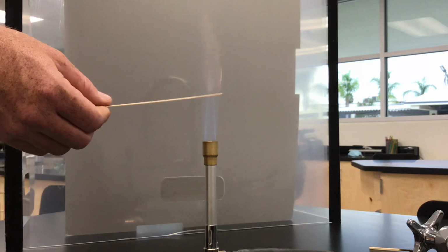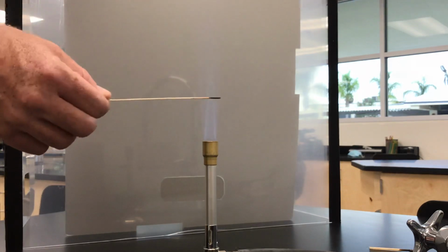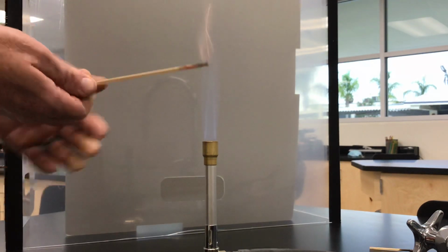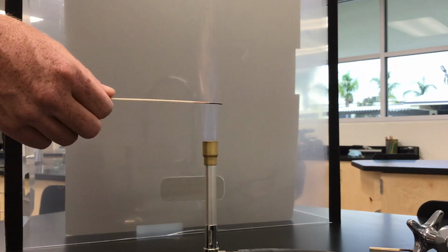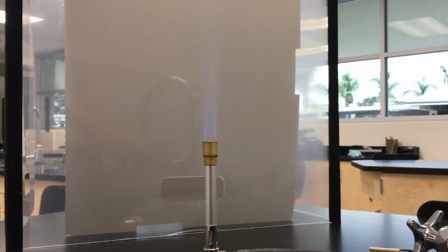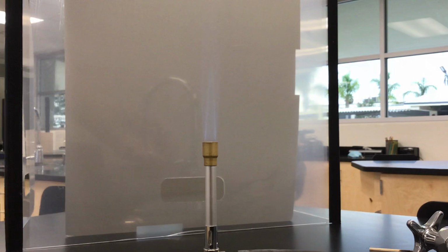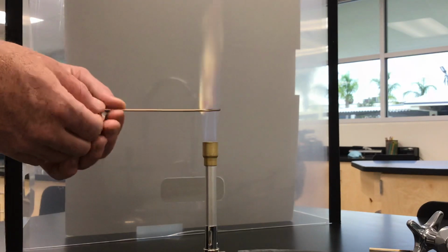Cobalt. So once again, you're telling me observations that you see. So based on what you see, you'll identify some unknowns in a couple minutes. That is cobalt. Next up, I have a solution of barium. So underneath your solution, you can write barium. So that's barium.